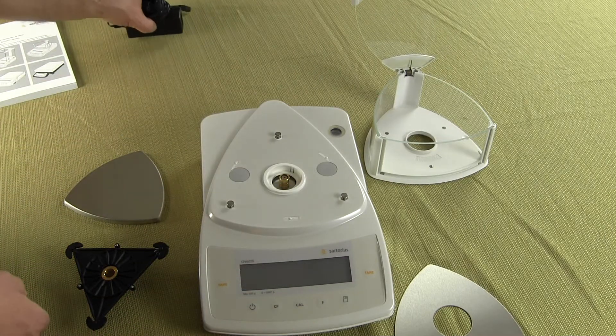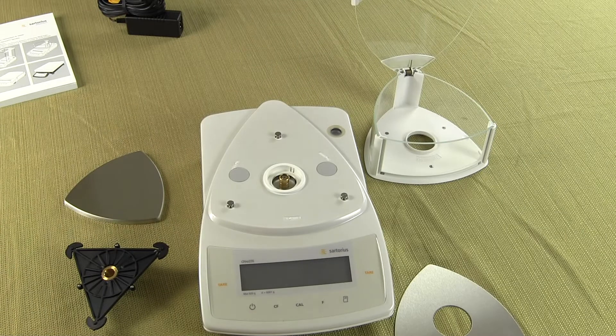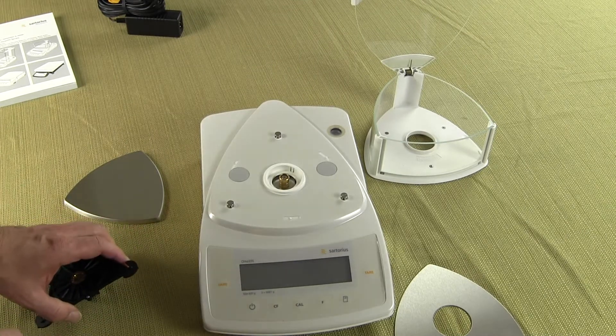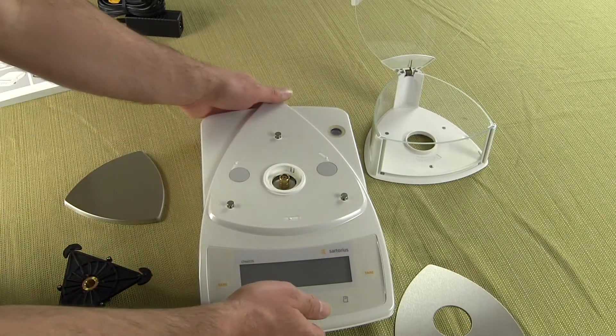So let's show you how to put this balance together and get it up and running. A couple of other small features before we assemble the balance just want to show you.